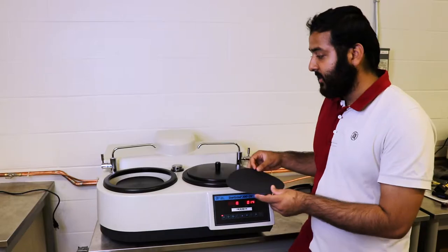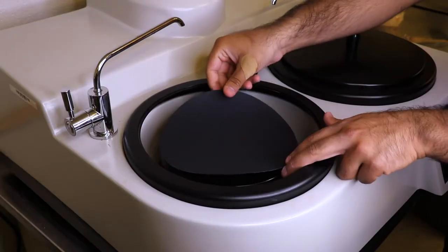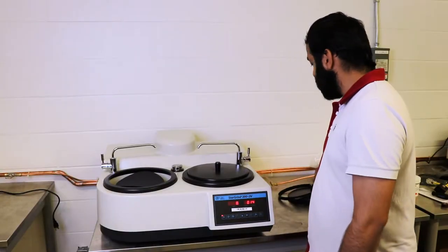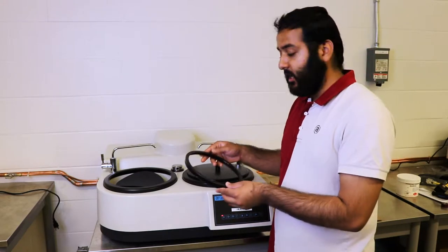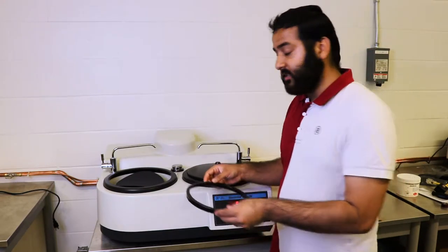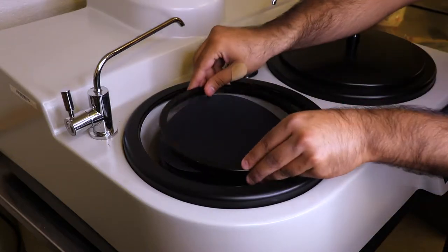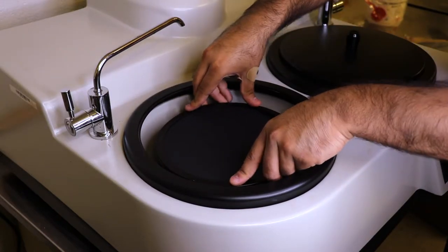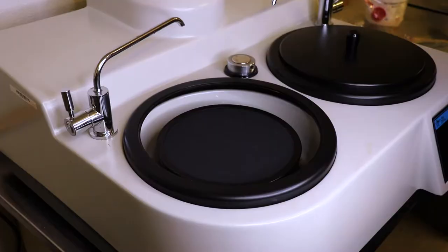You want to take your sandpaper and put it in the center of the rotating disc. Then bring your ring and place it back onto the sandpaper and around the rotating disc, and snap it back into place.